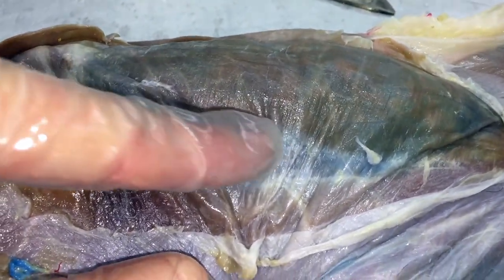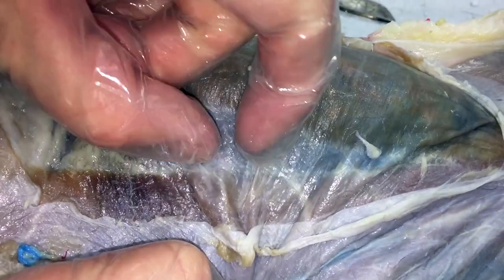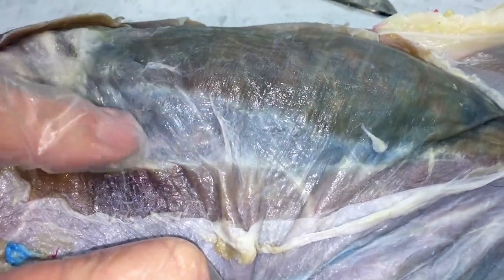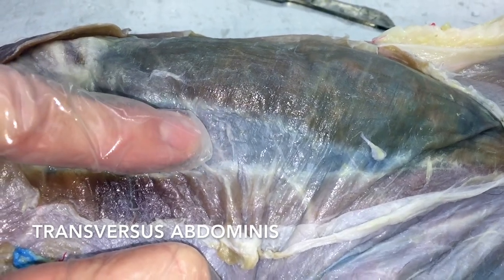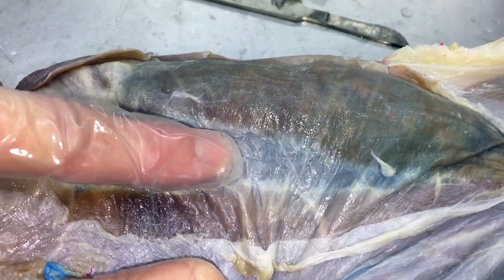If you look, there's actually a border. When it changes color, that means that's the end of one muscle and the beginning of the next. This little triangle — the deepest layer of abdominal muscle — is going to be your transverse abdominus. So if I stick a pin here, it's transverse abdominus.